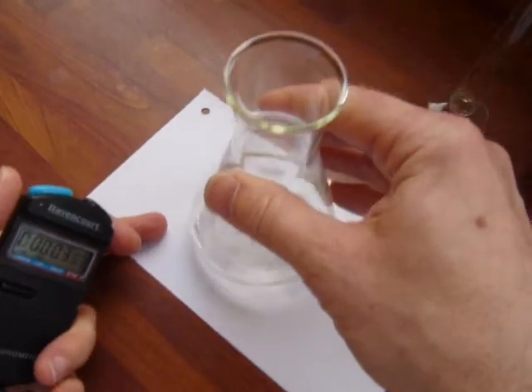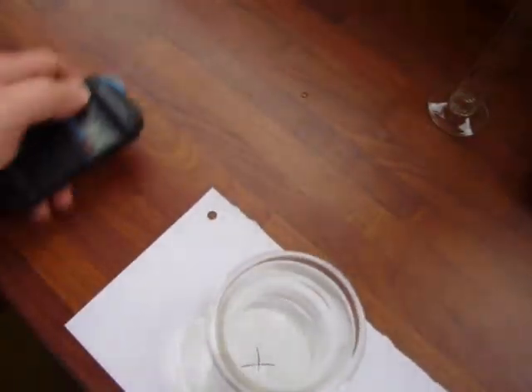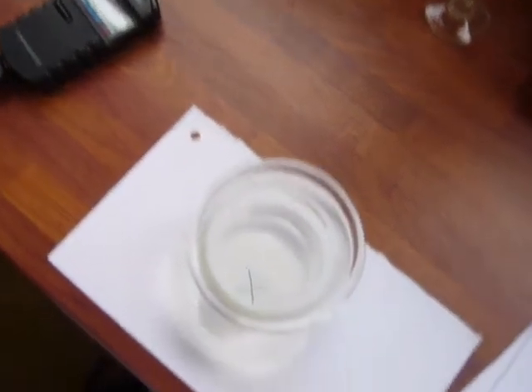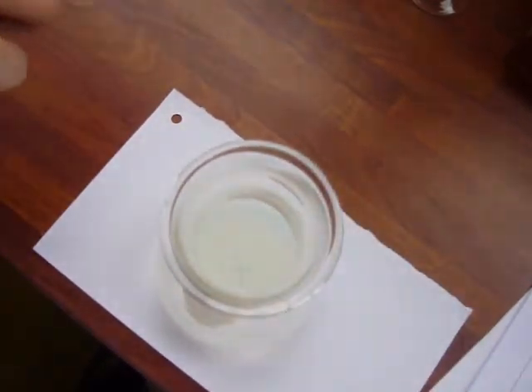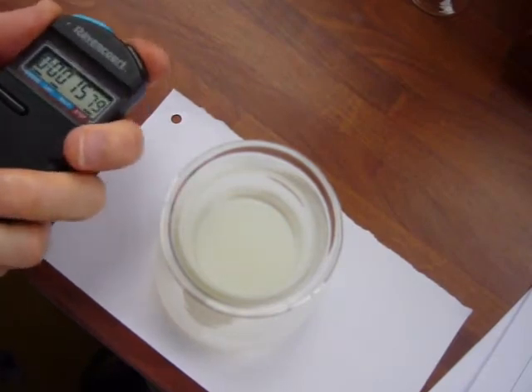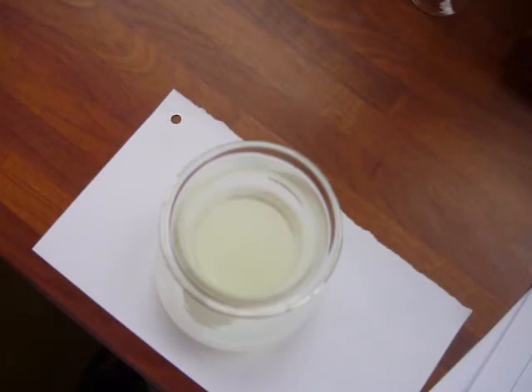Give it a good shake. Now, you may not be able to see the cross from there yet. I'll just adjust it so you can see the cross. If the solution goes cloudy, you stop the stopwatch when you can no longer see the cross. It's a very simple experiment in principle.